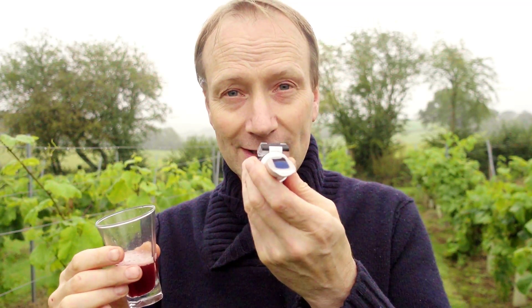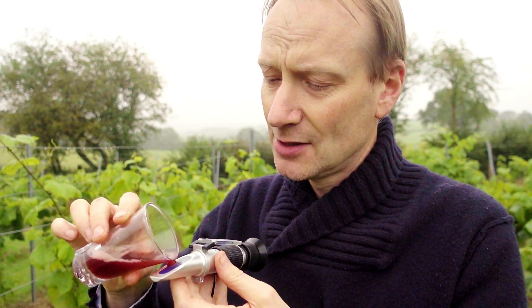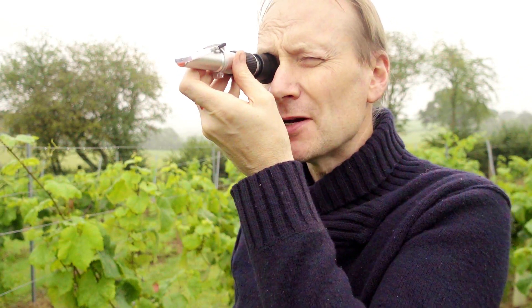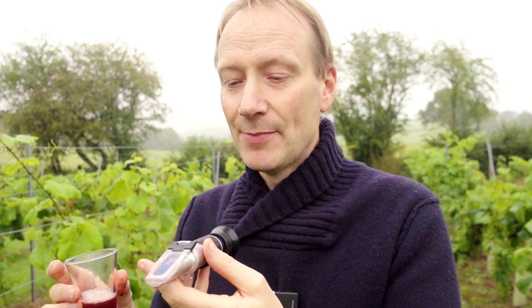Sweetness-wise it's not far off. With my refractometer, I'm just going to pour a little bit of juice on the lens — you can use a pipette which is probably better. There we go, squish it down, get rid of all the air bubbles, and have a look through. This gives a much better idea of what the whole vineyard is doing. Looking through here on the Brix scale, which gives a percentage of sugar, we're up to 18% sugar. That would very roughly give us a 9% alcoholic wine — you roughly halve the Brix reading to get your finished alcohol content. It is only an approximation, so don't use it as a hard and fast guide.